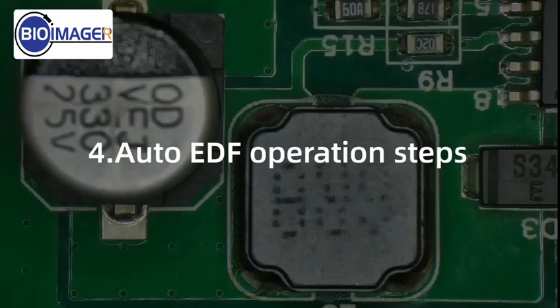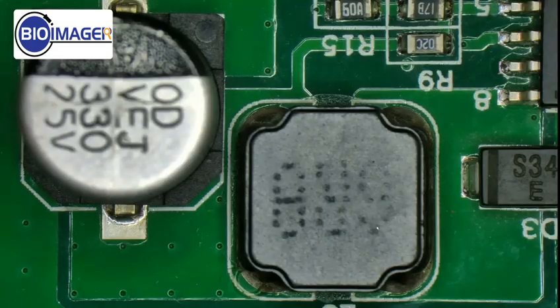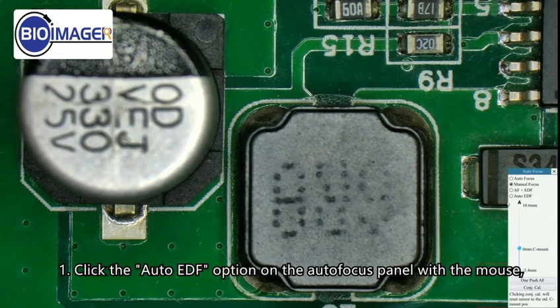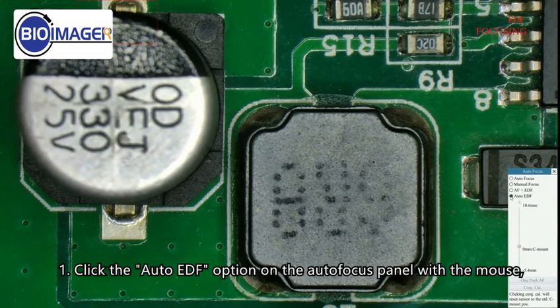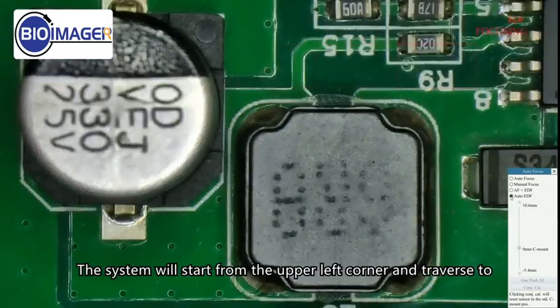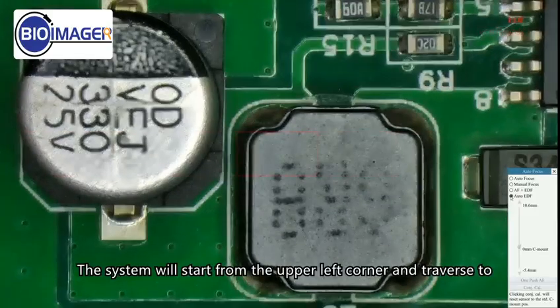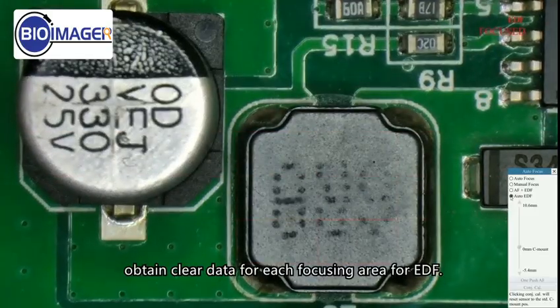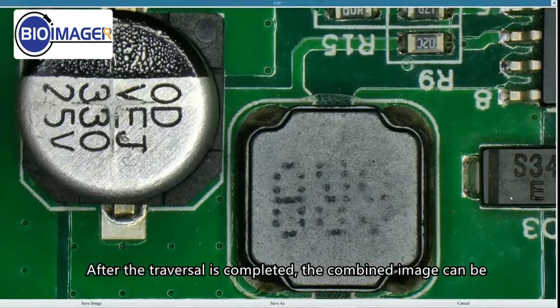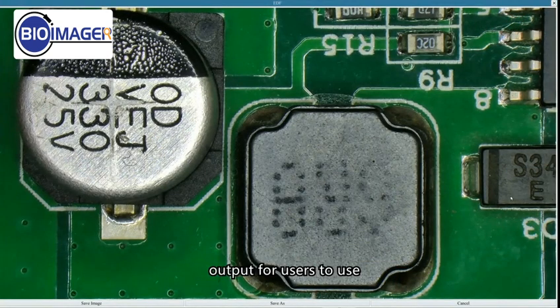Auto EDF operation steps. Click the Auto EDF option on the autofocus panel with the mouse, and EDF will be displayed in the upper right corner of the video interface. The system will start from the upper left corner and traverse to obtain clear data for each focusing area for EDF. After the traversal is completed, the combined image can be output for users to use.